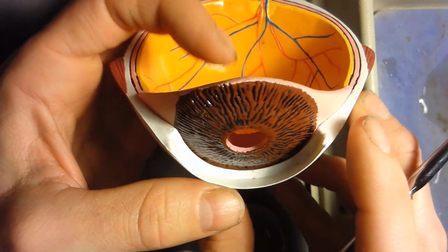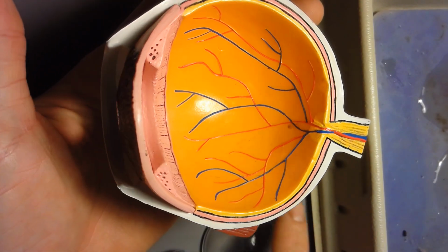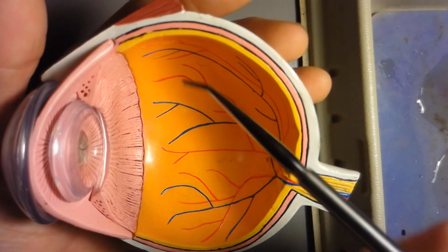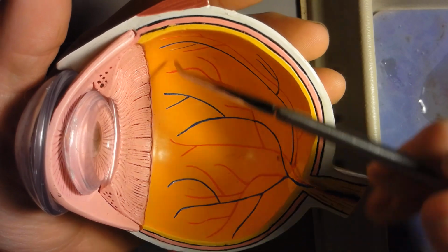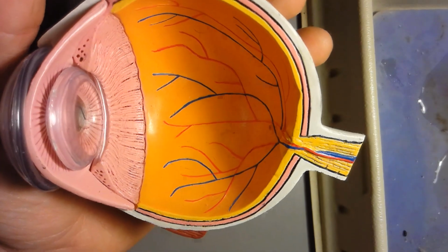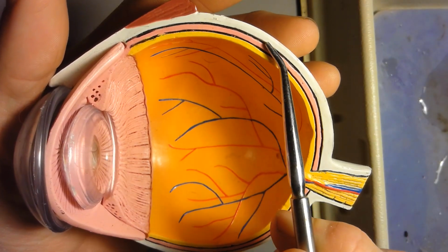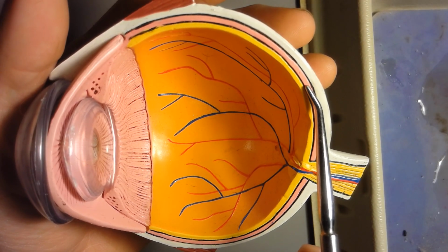pupil right there. Alright, the vitreous humor is another type of fluid that you find in the eye. This model does not have any fluids in it, so I will show you that with the actual eye. The next on the list is the retina. The retina is everything that's orange on the inside of the eye here. Okay, so everything orange here, very vascular. So all this orangey yellow color is the retina. The choroid coat. The choroid coat is an extension from the ciliary body, so it's pink, and it goes around and wraps around the whole eyeball. So this pink layer right here is the choroid coat.